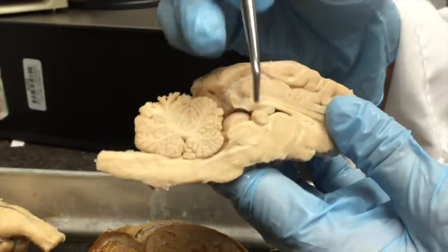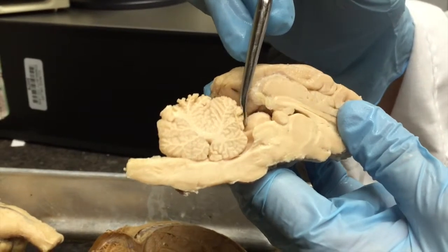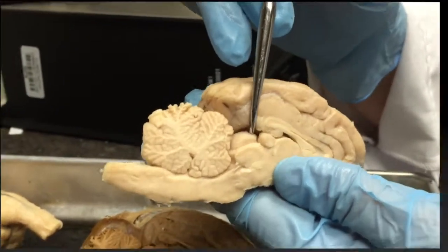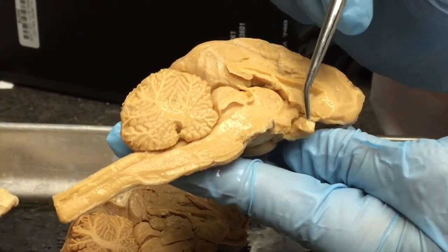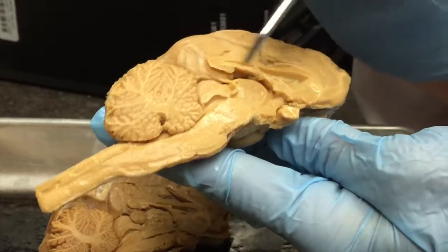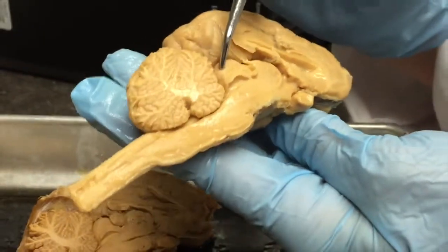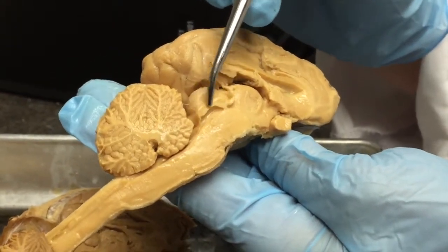We looked at the superior and inferior colliculi in another video, and here they are mid-sagittally. Here's one superior colliculus, and here's the inferior colliculus, and that's the posterior part of the midbrain. When you're looking at a mid-sagittal view, the other thing you want to take note of is that the optic chiasm has been cut. This is where the pituitary would have been, and this is where your mammillary body would be. This also shows the cerebral aqueduct because this cut of the brain was right along the midline. So here's your cerebral aqueduct, and you can see the superior colliculus here and the inferior colliculus right along here.